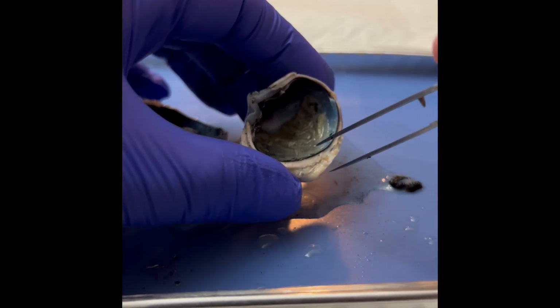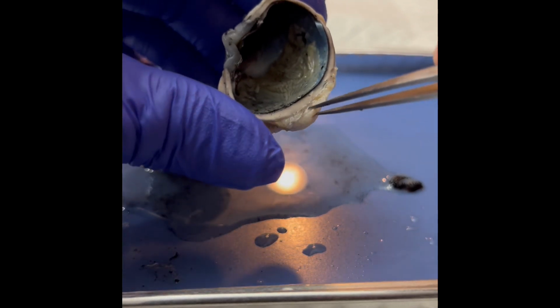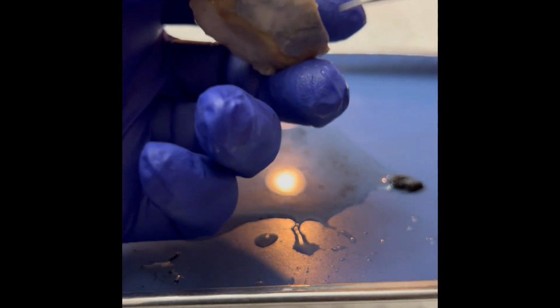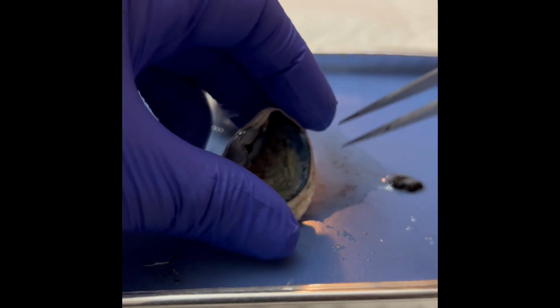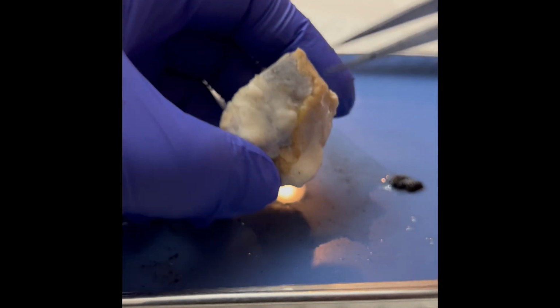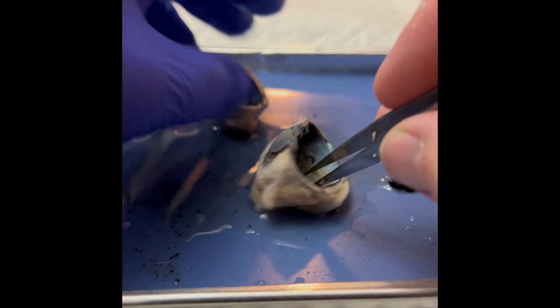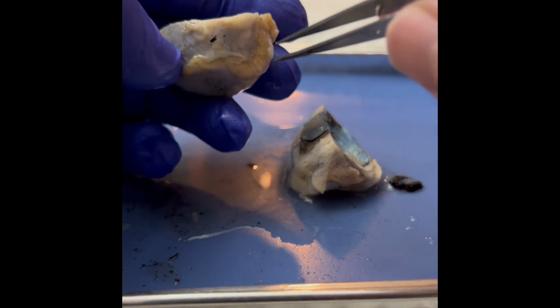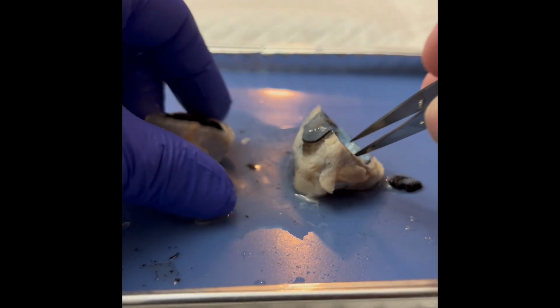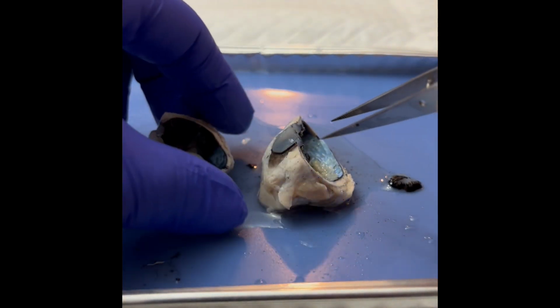So we'll start with cranial nerve 2, the optic nerve. It's going to be this chunk of tissue right here. You can see it from the back as well. It's slippery. Optic nerve. The extrinsic eye muscles are going to be these muscles around the eye. You can see it in the other eye as well, right here. And these move and position the eye as needed so that you can see in different directions.